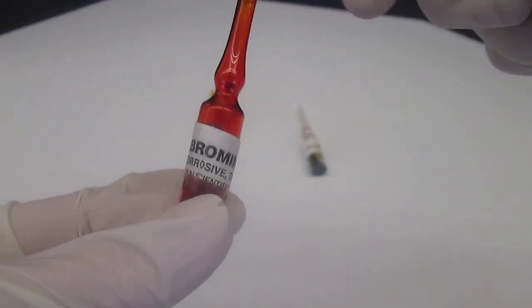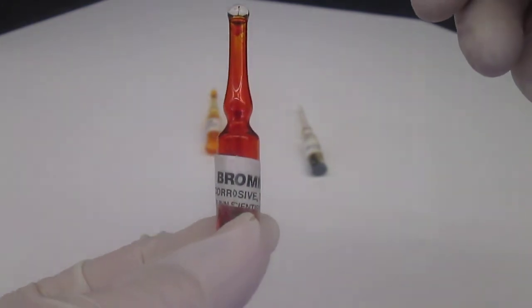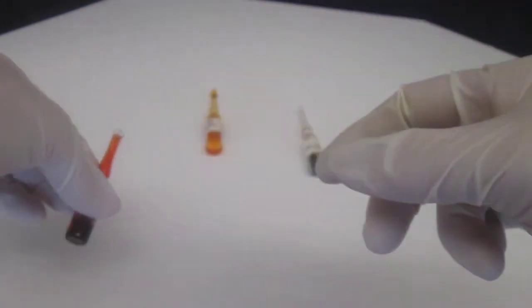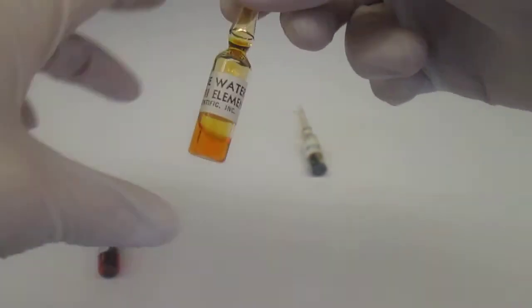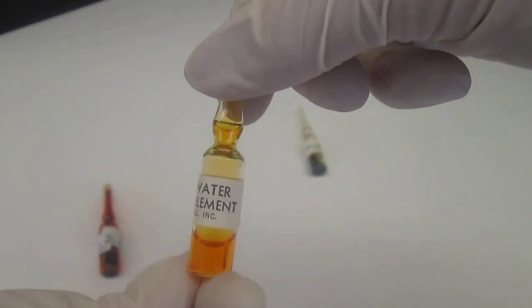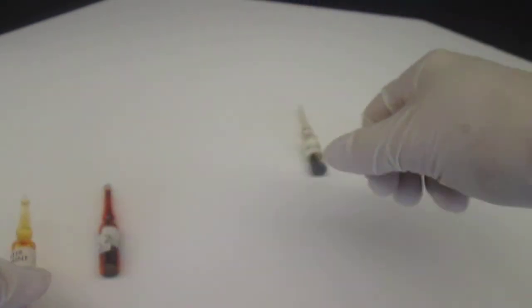If we were to break the glass ampule that this is in, it would be very similar to spilling bleach on ourselves. Now, there is a much more subdued version that can be sold on the everyday market called bromine water. Not really used that much anymore, probably was used as a cleaner at one time.